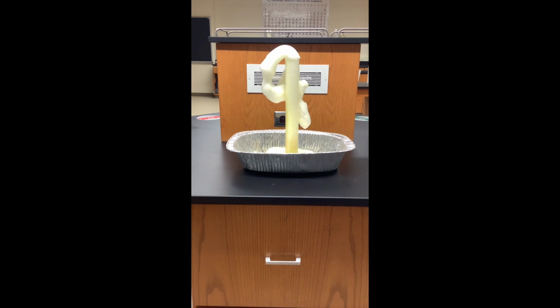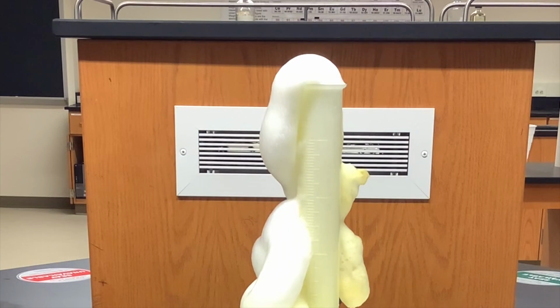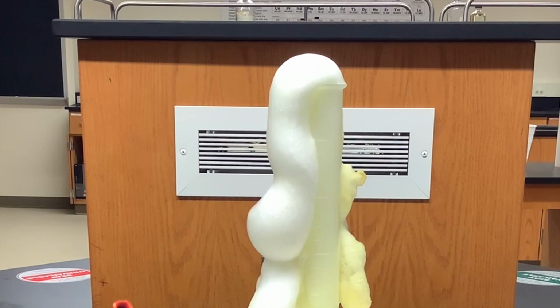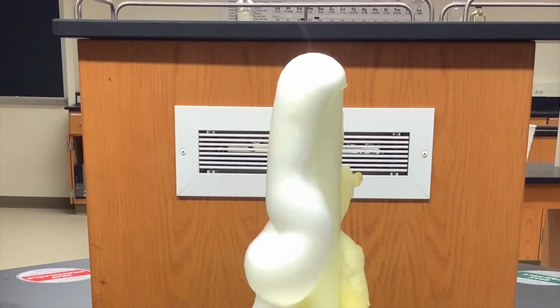So I've got a lot more bubble formation when I add the catalyst, and I can check to see if this gas is really oxygen by lighting a fire in it. So I'm going to light a match, and then I get a wooden splint burning. What I want to do is burn it down so just the embers are showing, so we don't really have any more combustion. That's the point where I'm going to insert it in the oxygen.